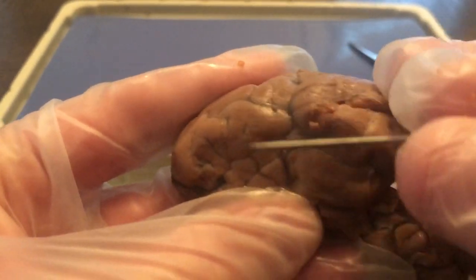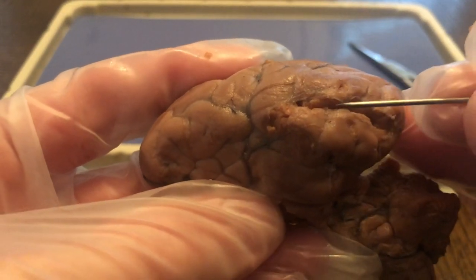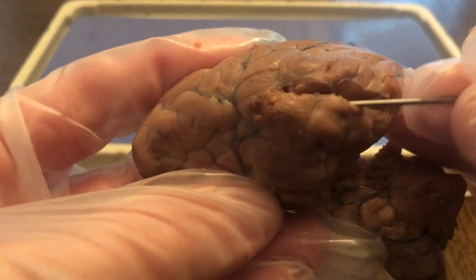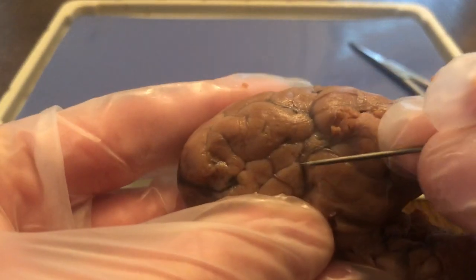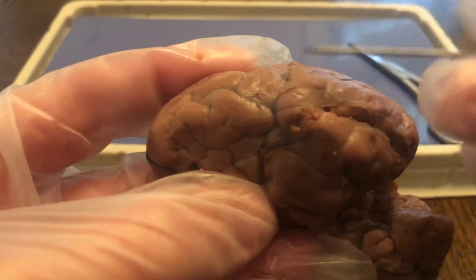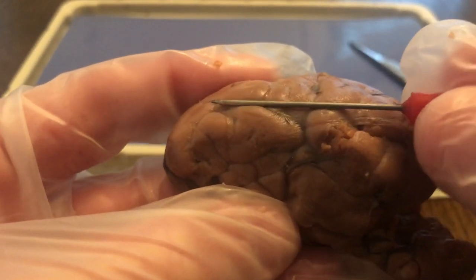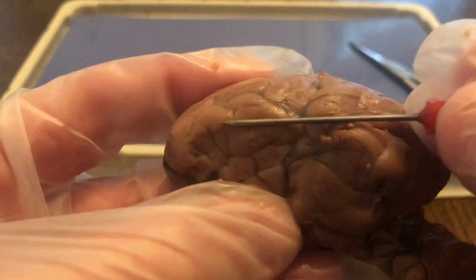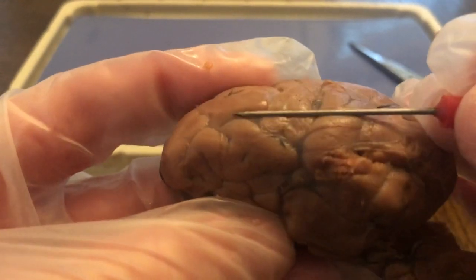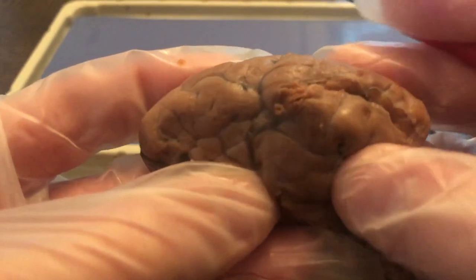And we actually have a thin tissue or membrane around the brain that protects it. And you can see these little indentations here. And you also have, of course, the brain case, which is the cranium that protects it, because you can see how soft and squishy and very delicate the brain is.